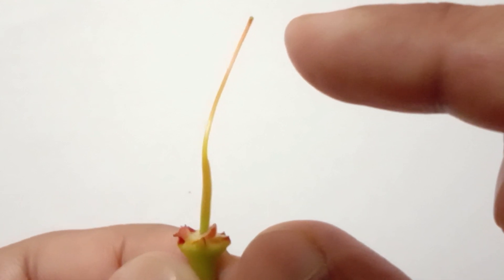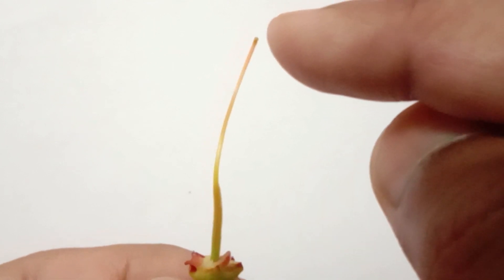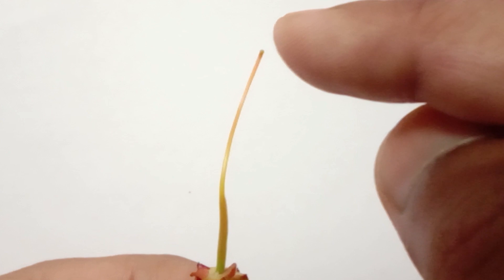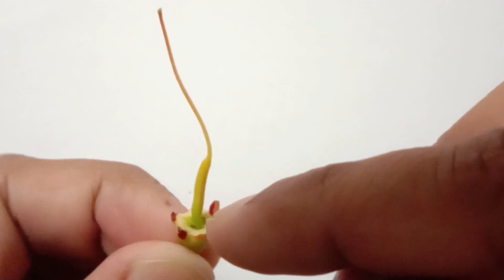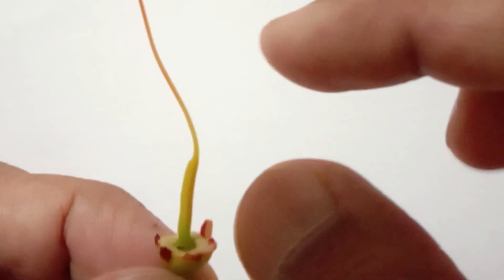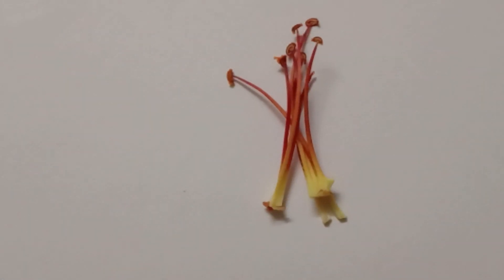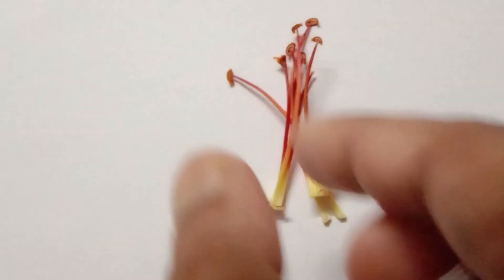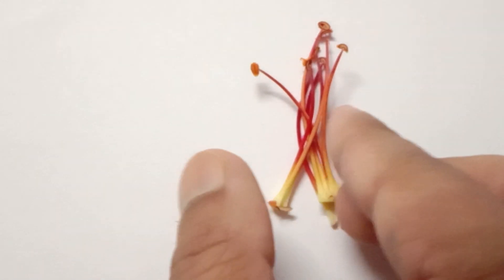Sometimes the pistil is also referred to as carpel. The head of this pistil is referred to as stigma. This tube-like structure is referred to as style, and the base of the female reproductive part is quite swollen — this is called the ovary, the green color swollen part, and it contains ovules in it. If there are many male reproductive parts in a flower, all together they are referred to as androecium.